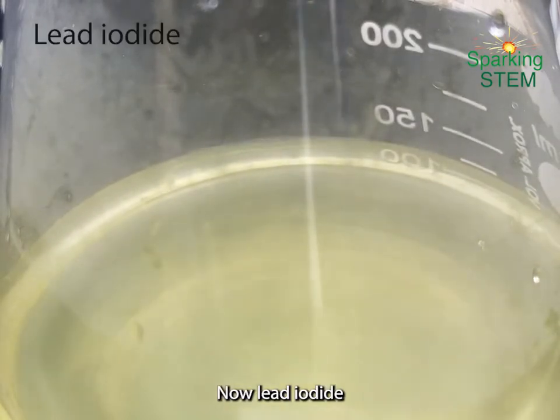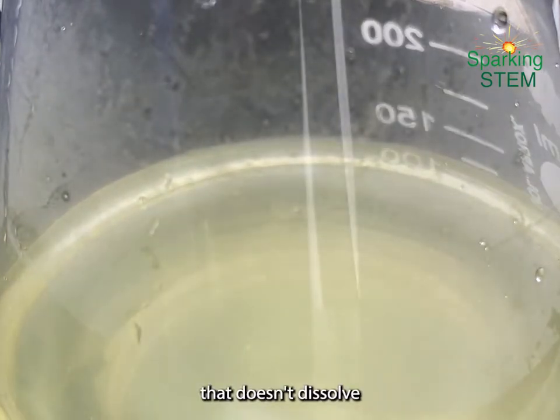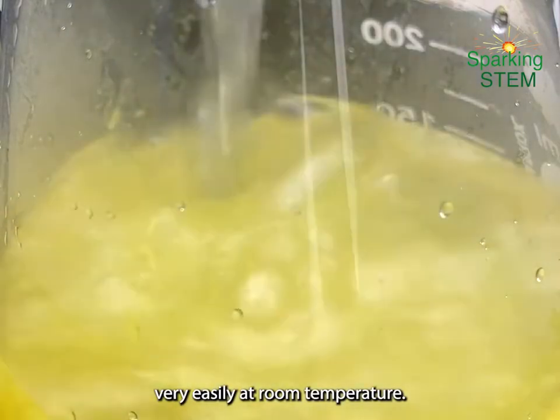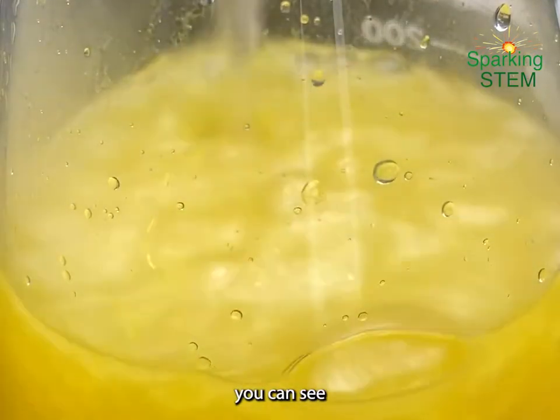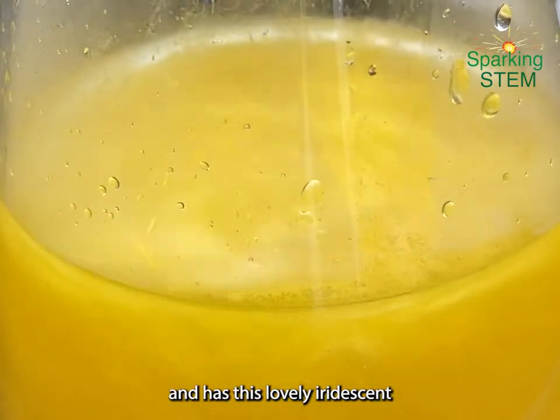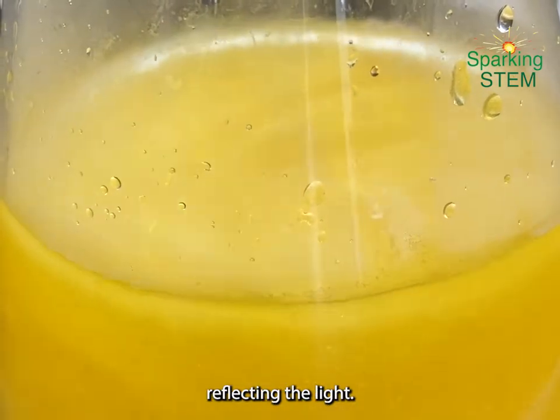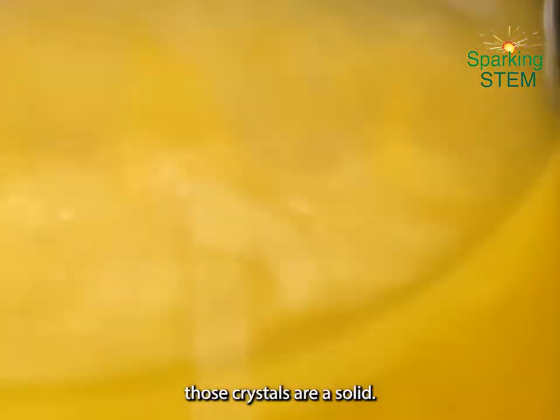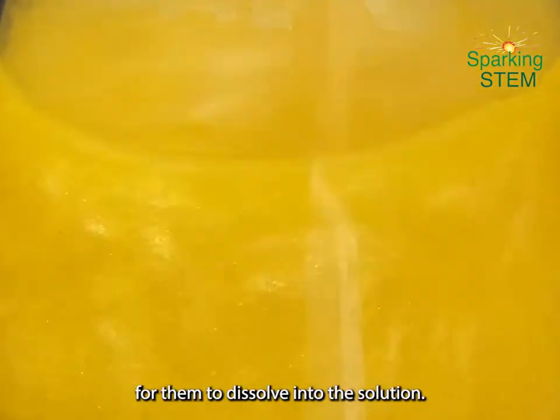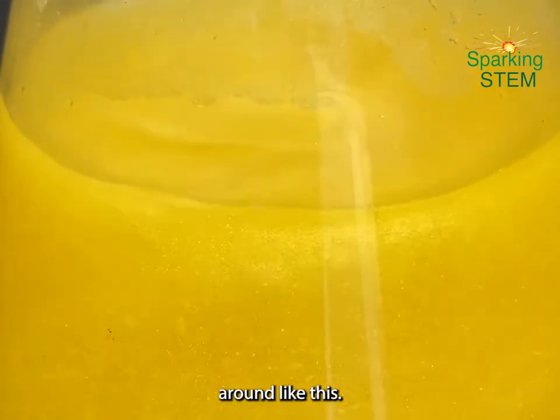Now, lead iodide is this bright yellow solid crystal that doesn't dissolve very easily at room temperature. If I add lots of it, you can see the solution goes really deep, dark, opaque yellow and has this lovely iridescent shimmering quality because of the crystals reflecting the light. But because we're not working at a high temperature, those crystals are a solid. It's very hard for them to dissolve into the solution, and so you can see them swirling around like this.